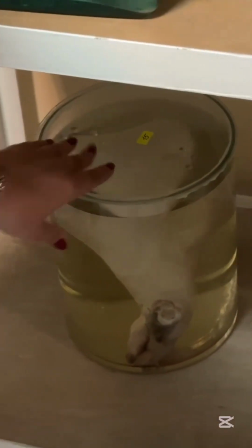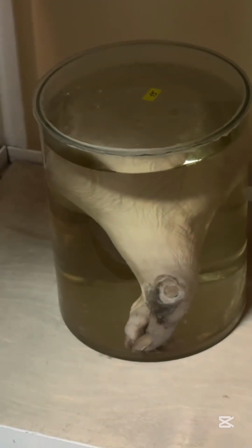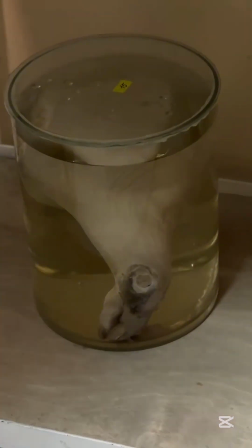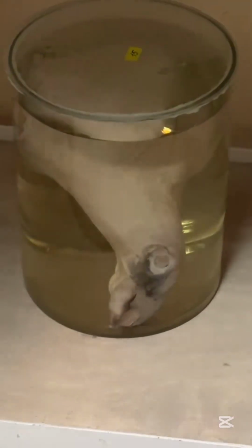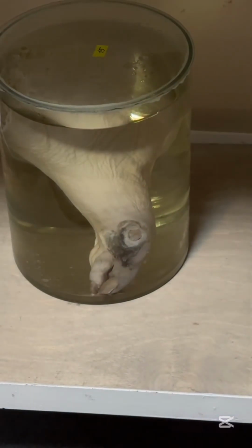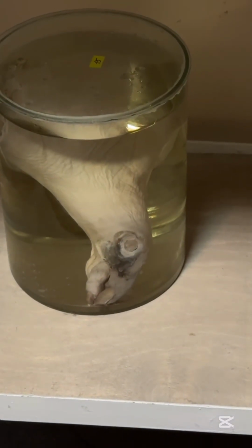And this one is last, foot gangrene. Foot gangrene, that is dry gangrene. You see black areas with necrotic tissue. How can we distinguish dry and wet gangrene? We see a clear demarcation line, like a border between necrotic tissue and normal tissue. If it is visible, that is dry gangrene. Most often it happens due to atherosclerosis of the arteries of the lower extremities.